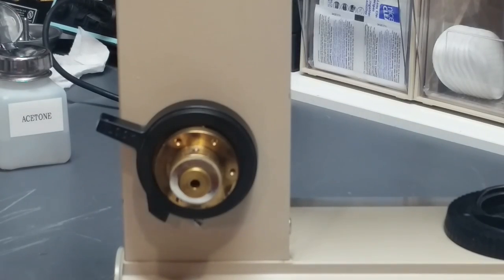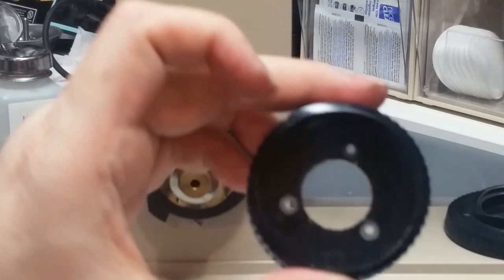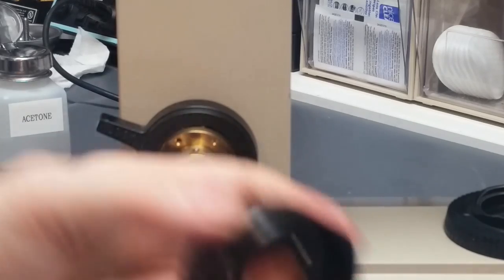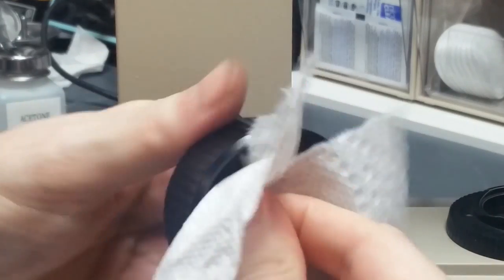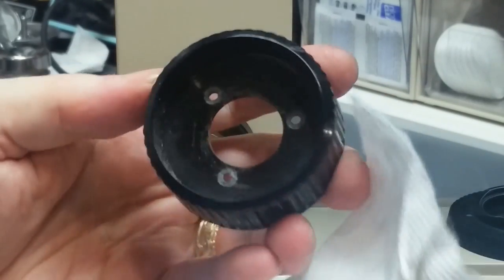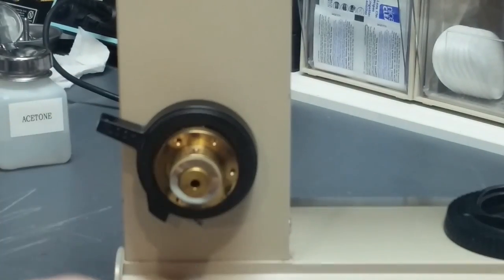and I've got the coarse focus knob for this side. Going to clean up the inside. It's got a little bit of oil inside of it. Clean that up. Okay, she's ready to go on there.